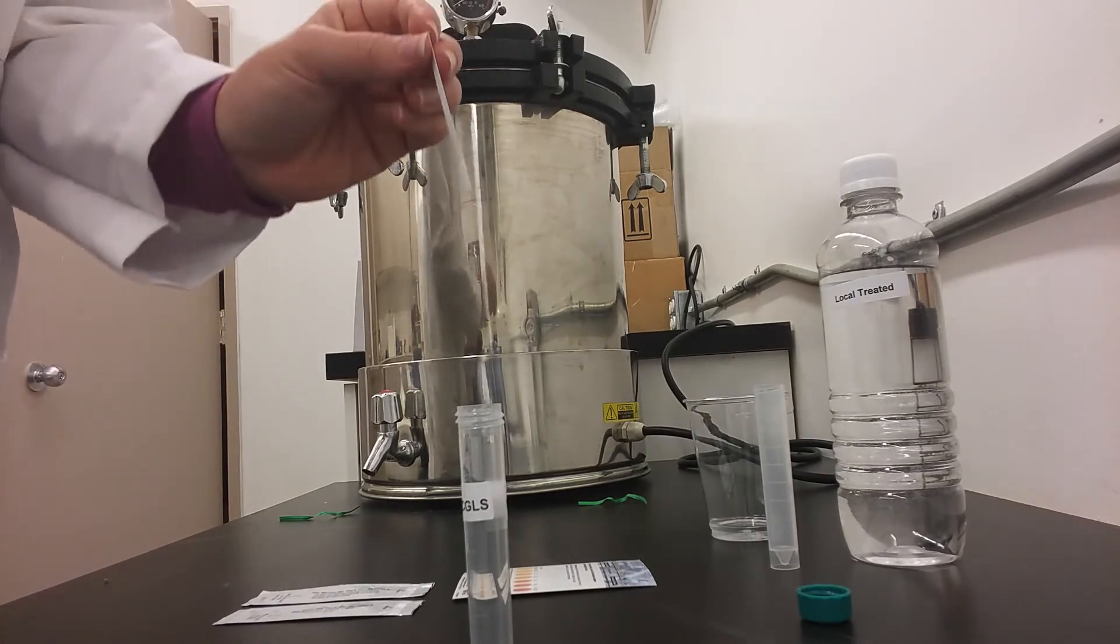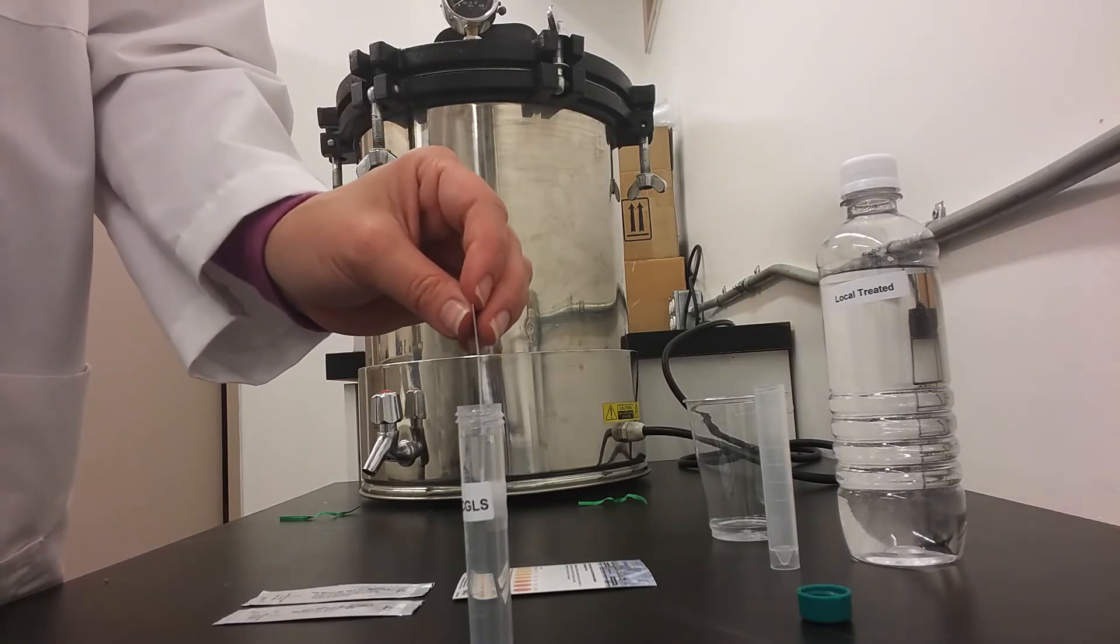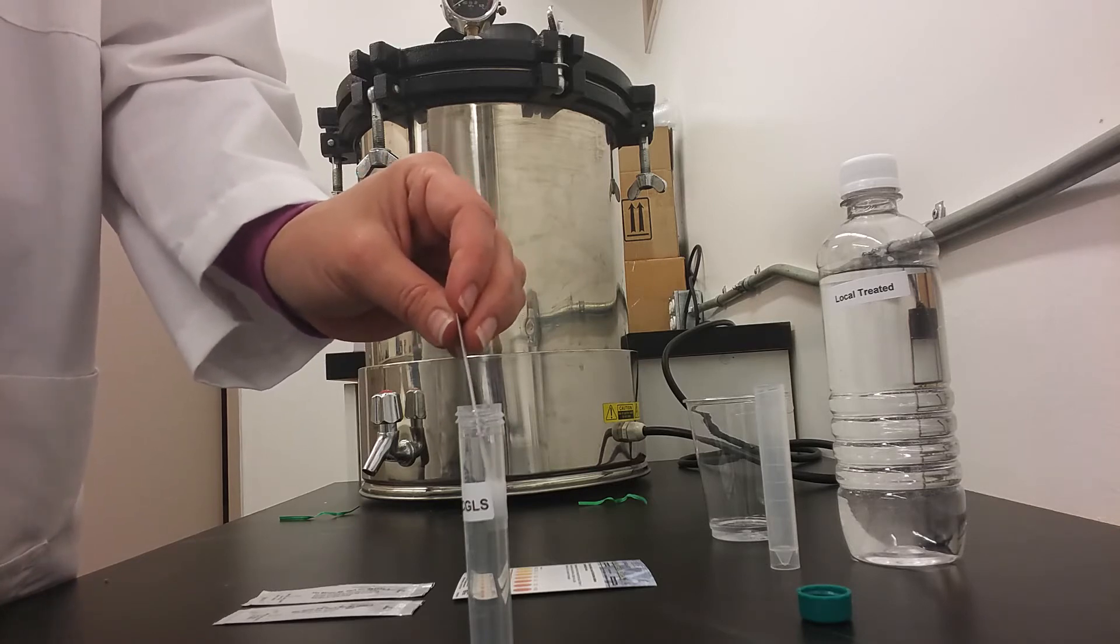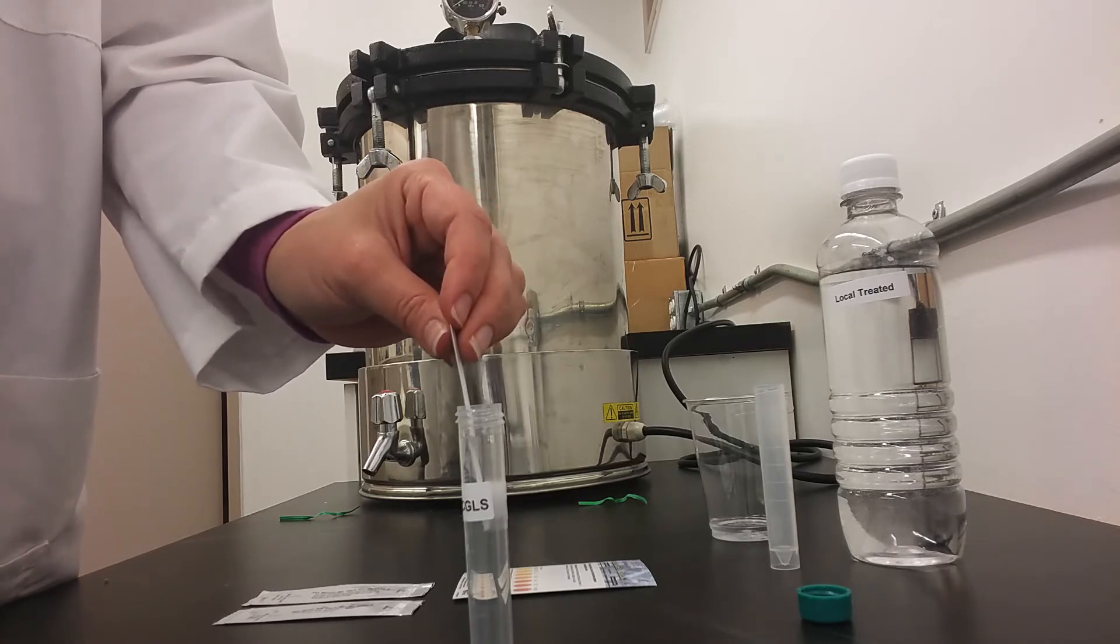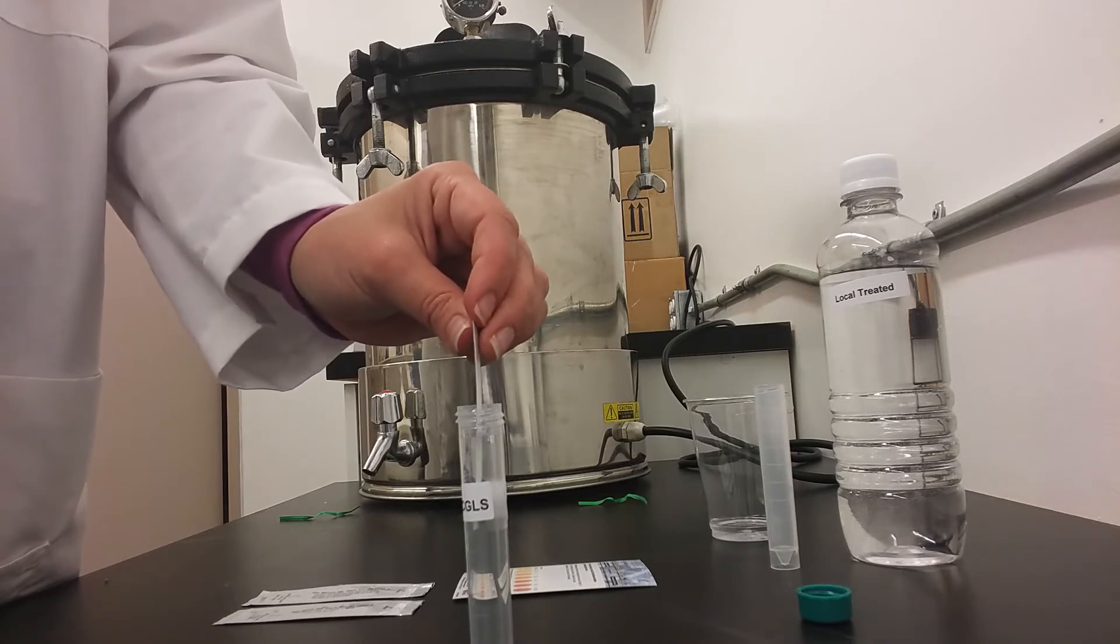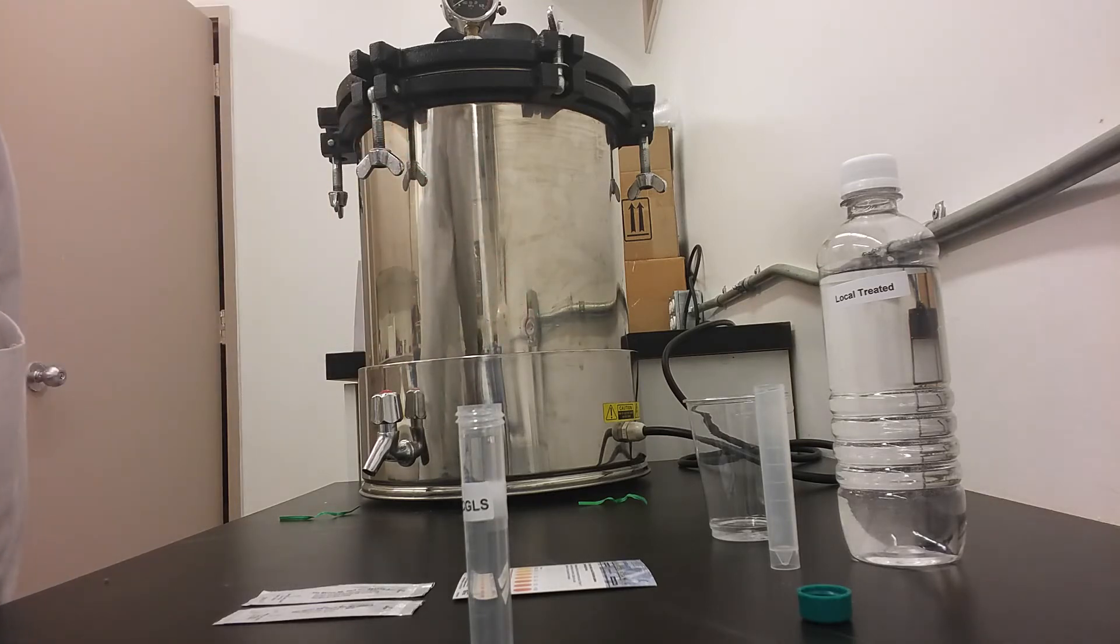You will then dip that test strip into the water and move it back and forth for 20 seconds. Then you will remove the test strip and throw it away.